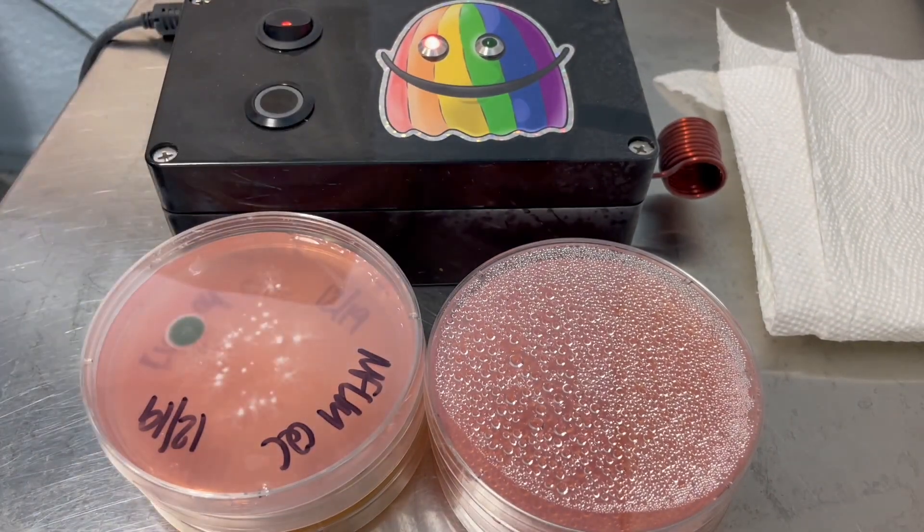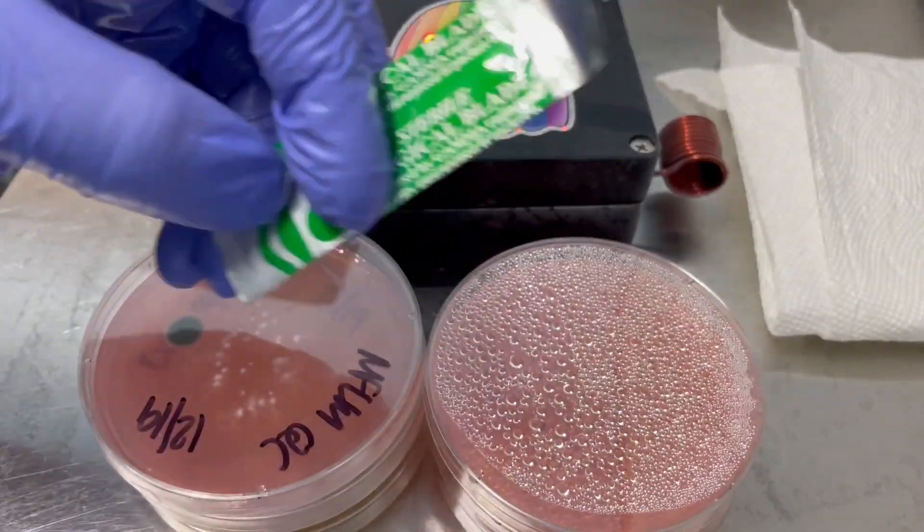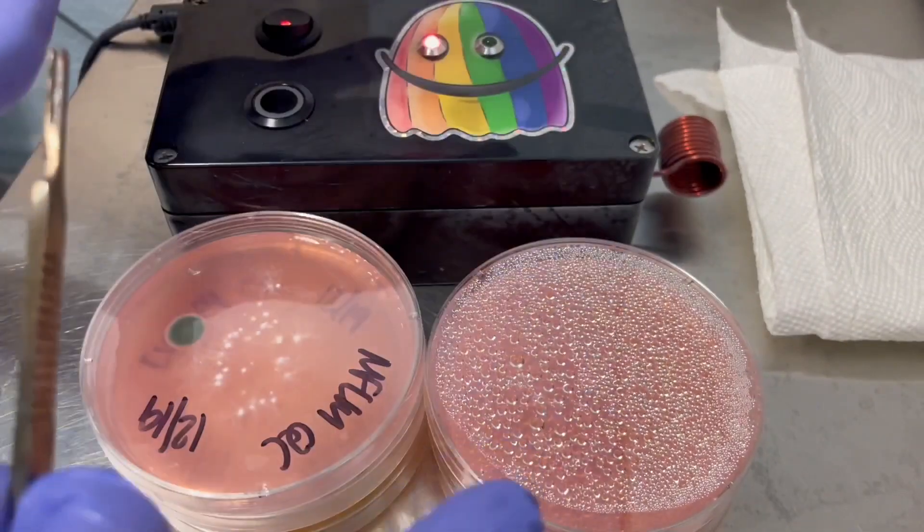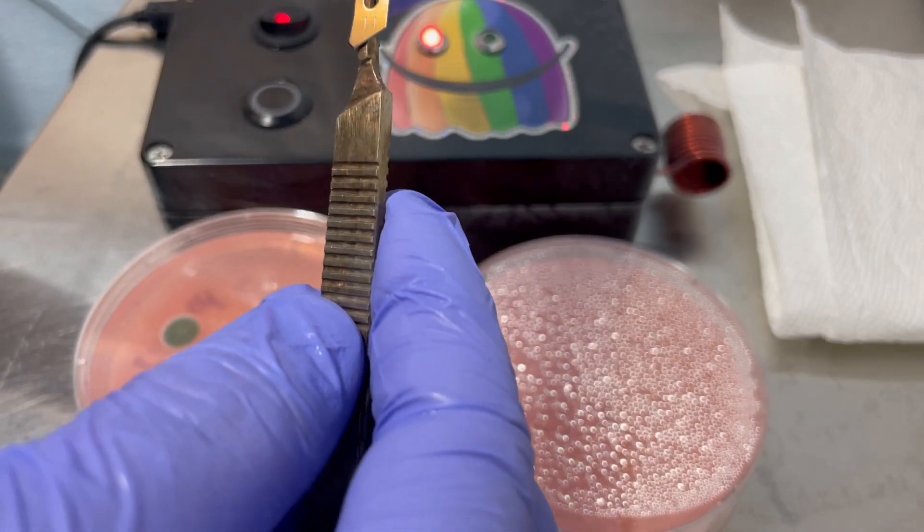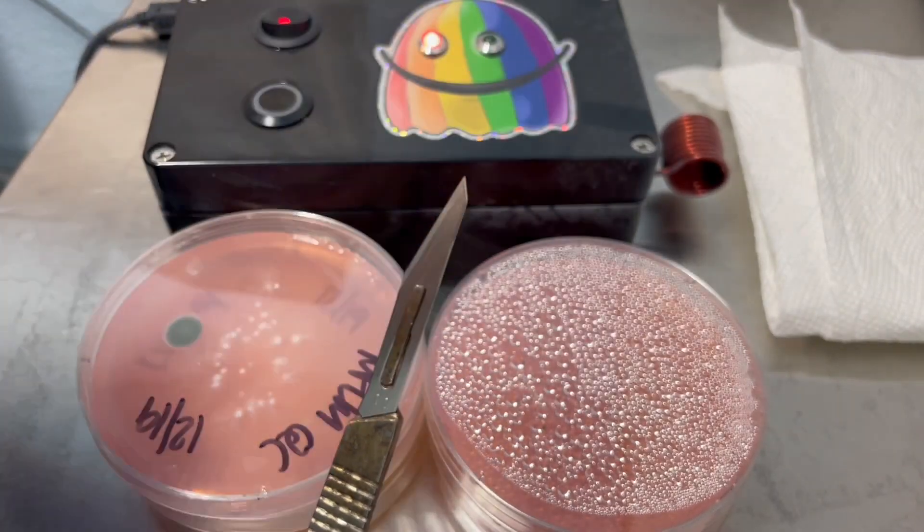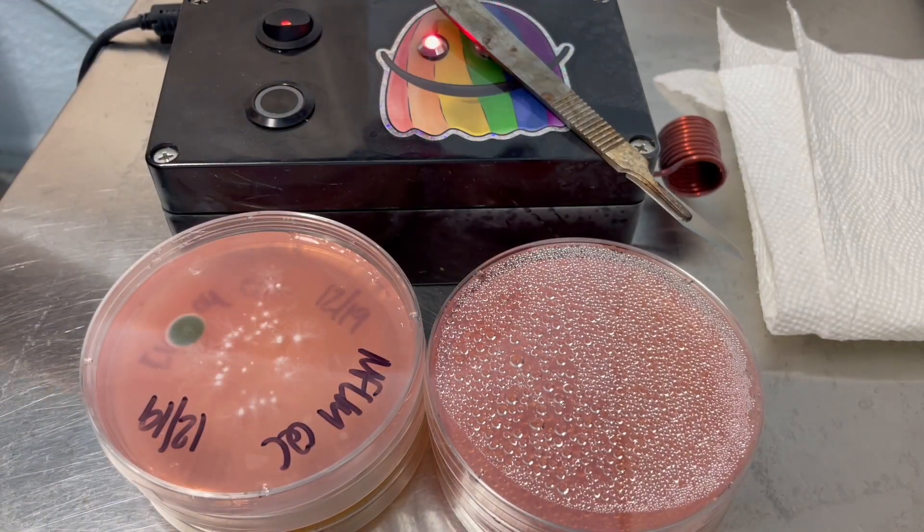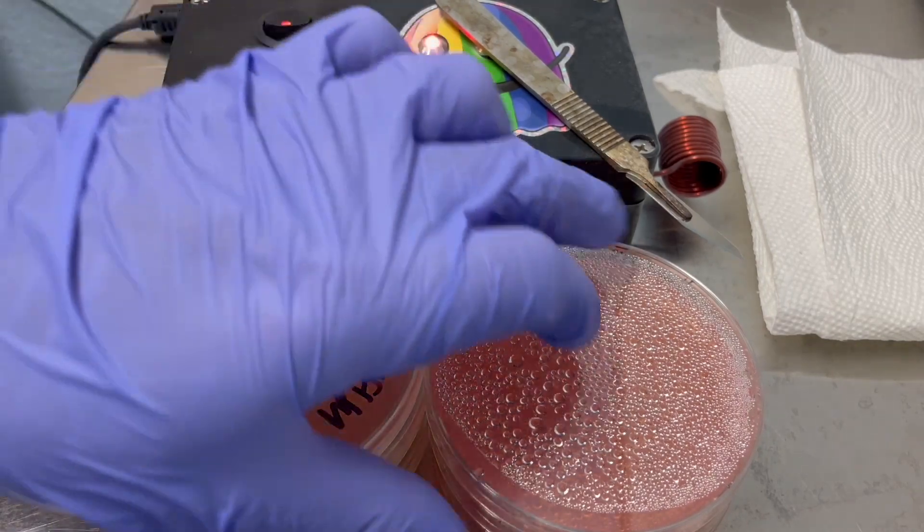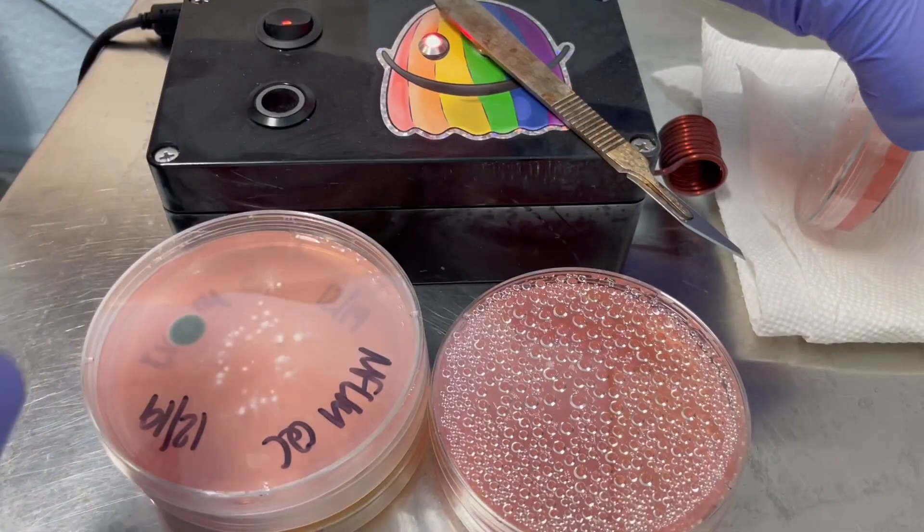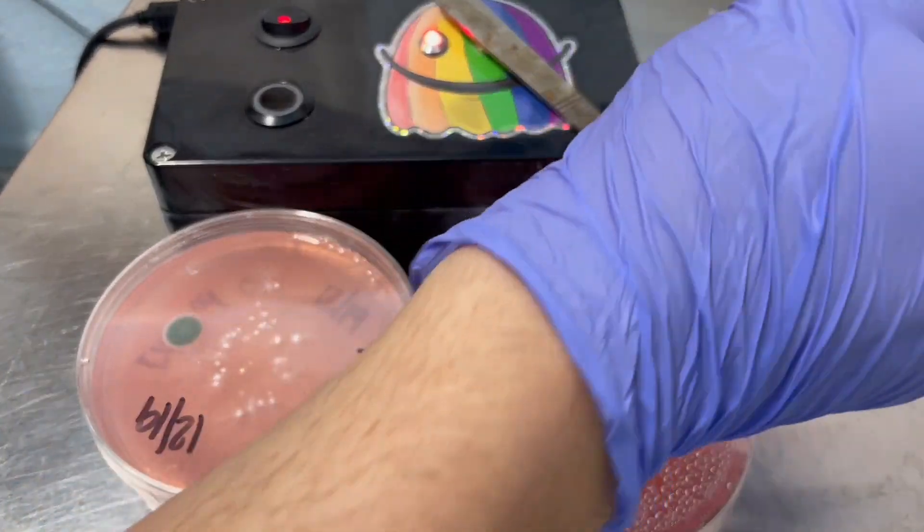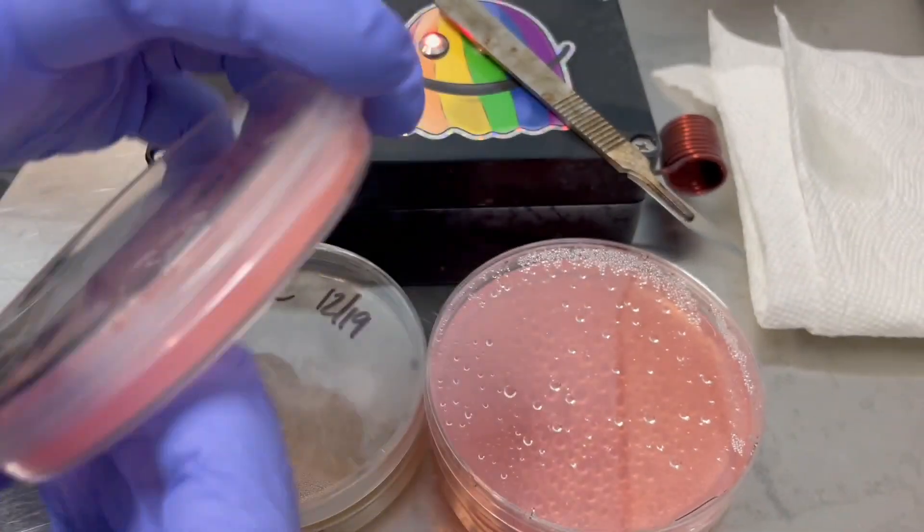Okay guys, I'm not super worried about this because I have so many backups. But just to show you guys the method that I use, I'll run through this very quickly. So the first thing I'll do is just spray down everything with isopropyl and get my sterile blade ready. So I like using the number 11 blades because they have that nice sharp bevel. And once again, I said that I'm not going to turn on my flow hood for this procedure just because I don't want these spores blowing everywhere. And if you notice some condensation on your plates, you can just tap that onto a paper towel and it's not that big of a deal. Okay, so I've got my petri dish here.